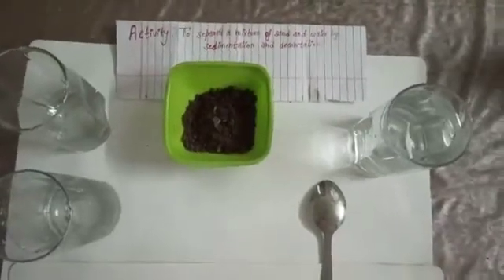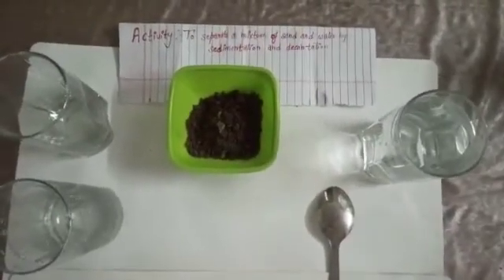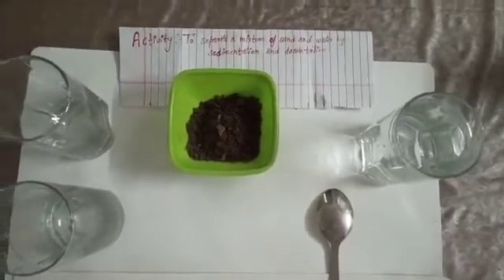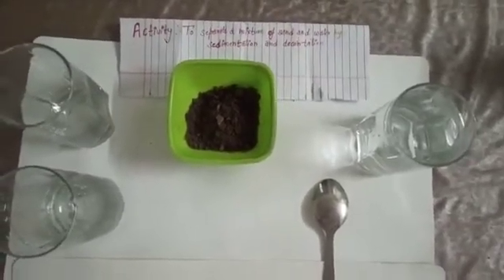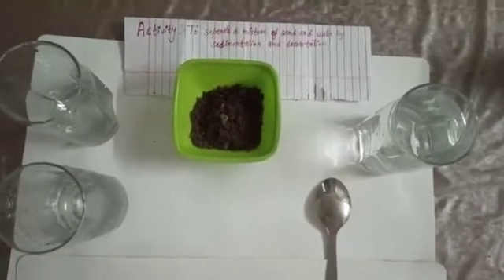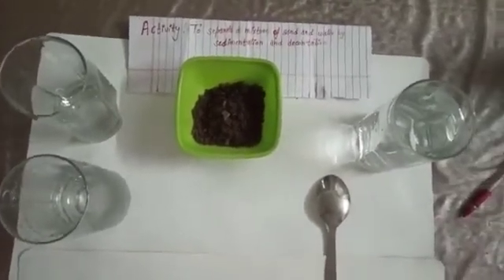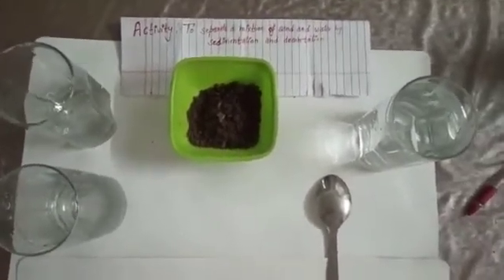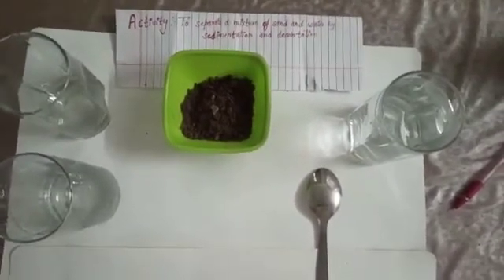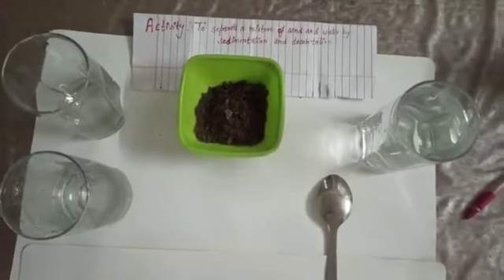Good morning, students. Today our activity is to separate a mixture of sand and water by sedimentation and decantation. You know, sand is insoluble in water. Hence, it can be separated by the process of sedimentation and decantation.